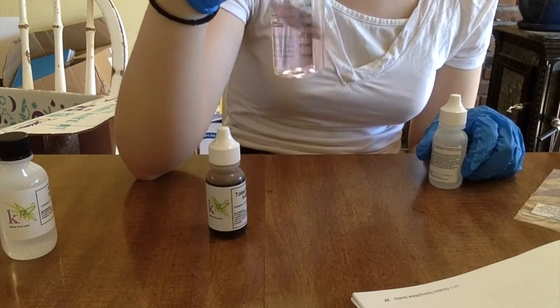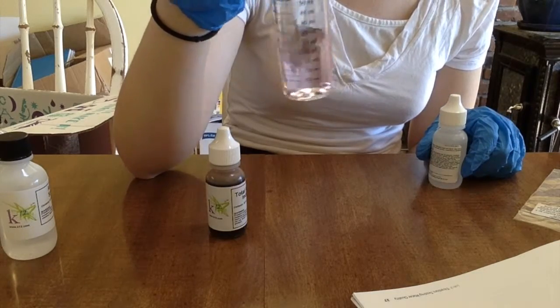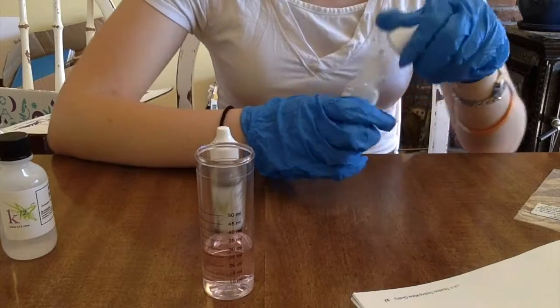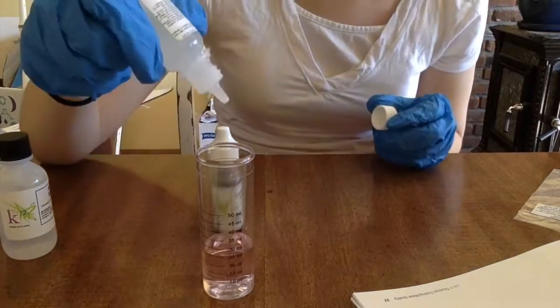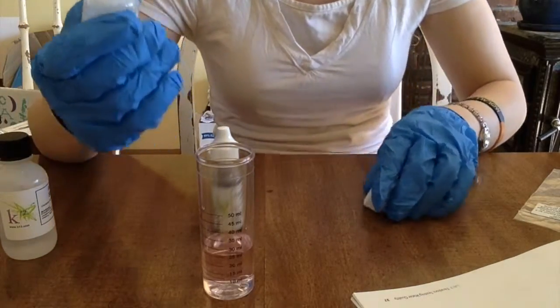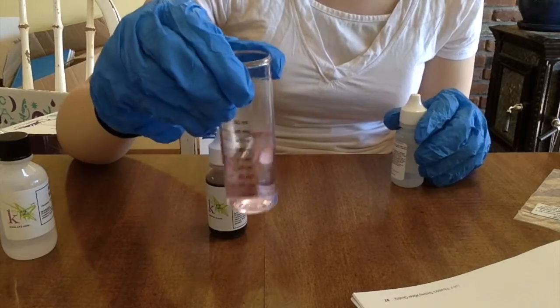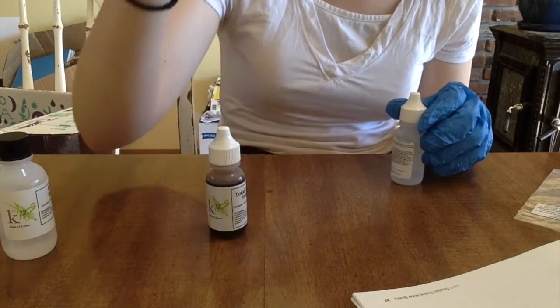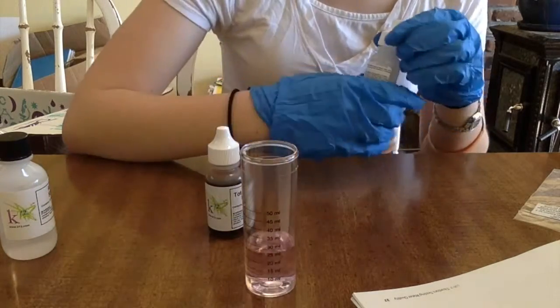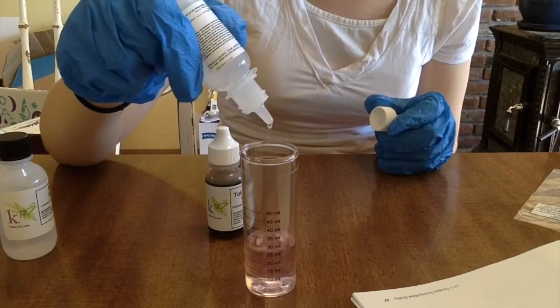If needed, add another drop, swirl, and check to see. More drops might be needed. Let's do one, two. It's getting there. Still, it shows it being much darker than that. Let's keep going: one, two, three, four.